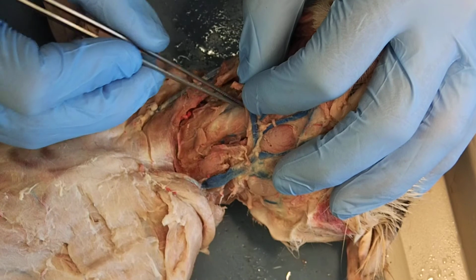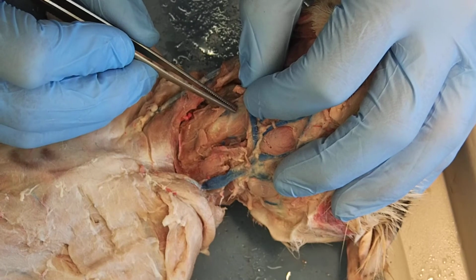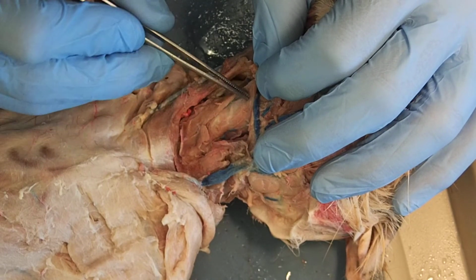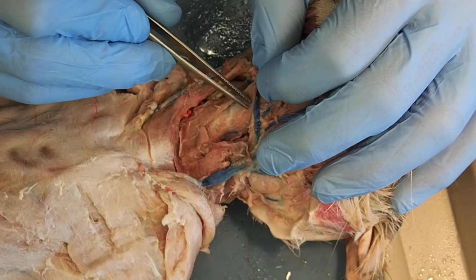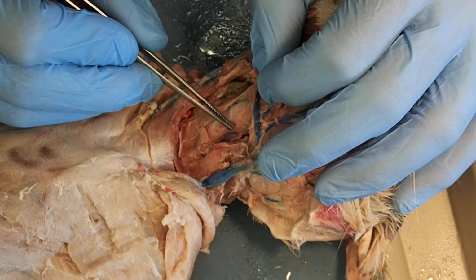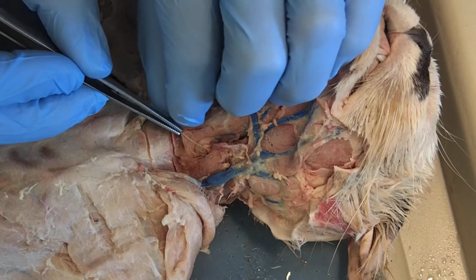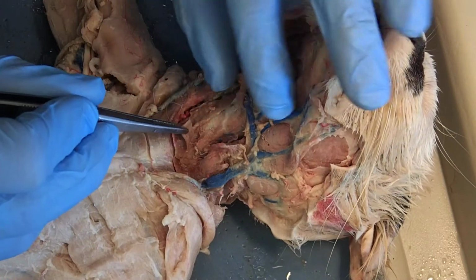And up here, this would be analogous to what you might call the voice box. All right, that's going to be my larynx. And if we look along the larynx, I have muscle running right on top of the larynx here. And it's running from the hyoid down to this region here. And then if I look on the other side here, I'm pulling away my sternohyoid.